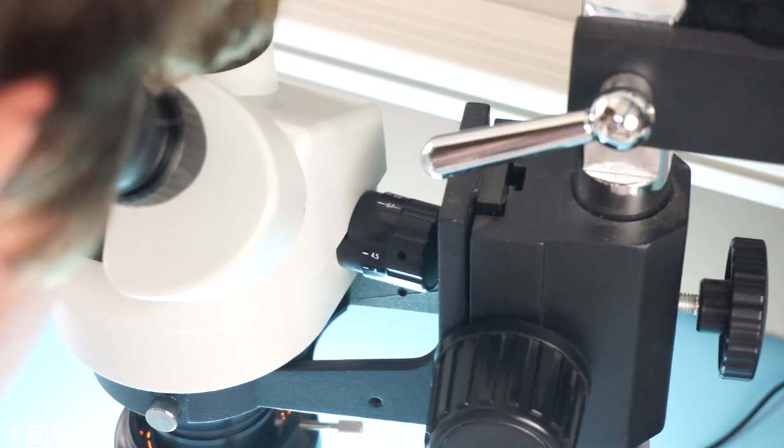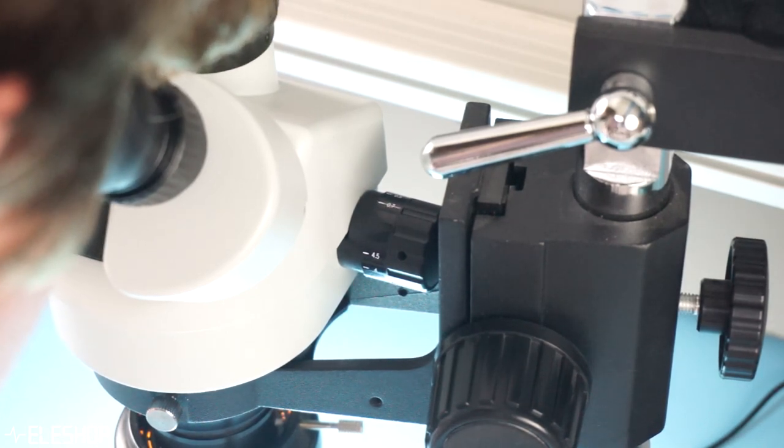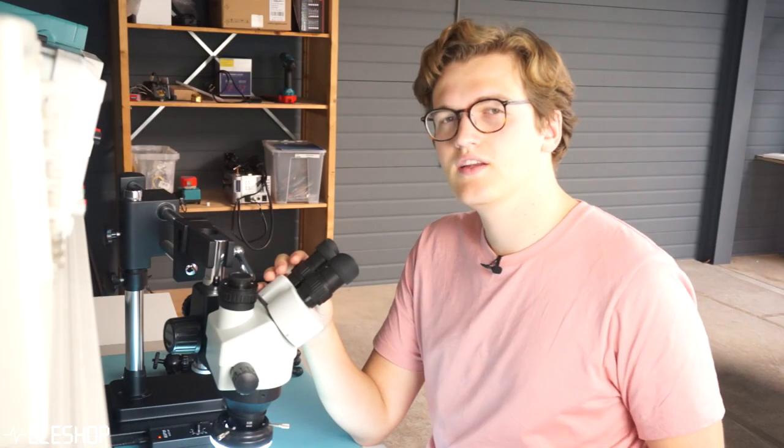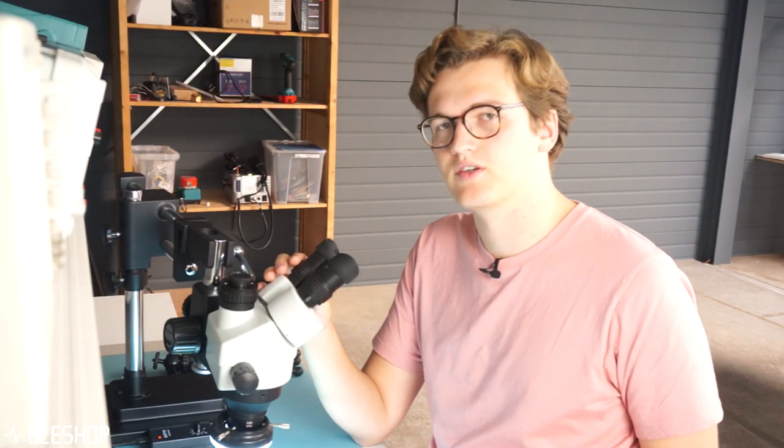Don't worry the image could be slightly out of focus so do not touch the focus knob anymore. Now we only still need to adjust the diopter knobs.